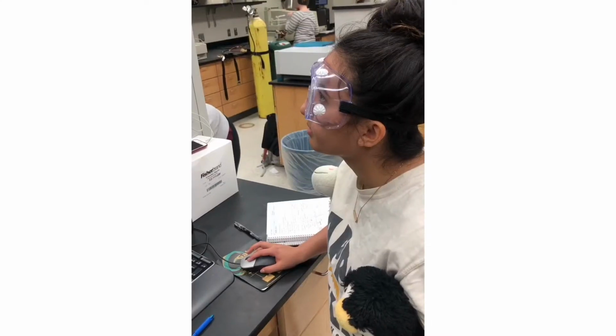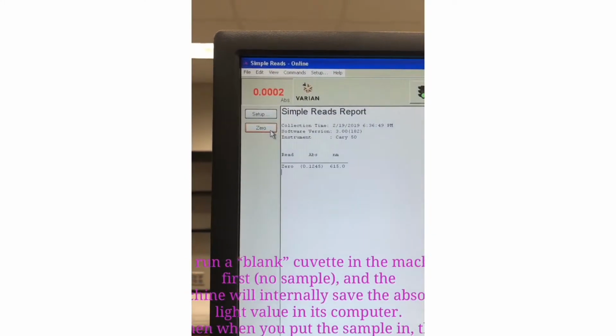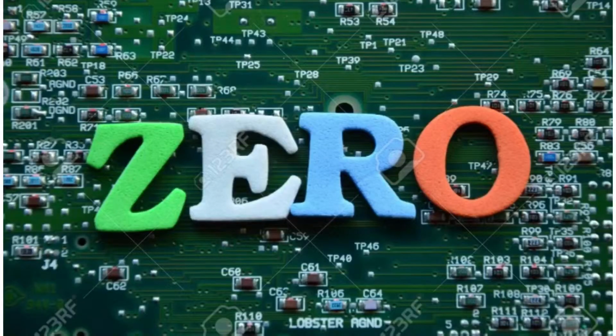You will then close the door and move over to the computer screen. You should find the 0 button and click it. The absorbency value should be close to 0.